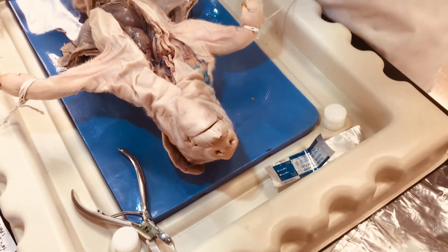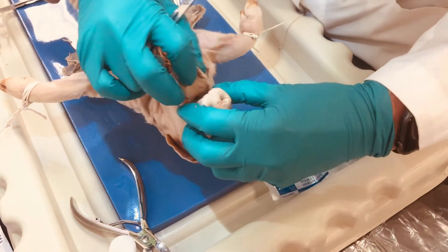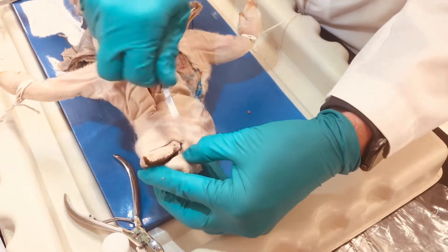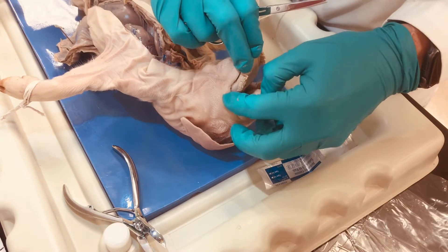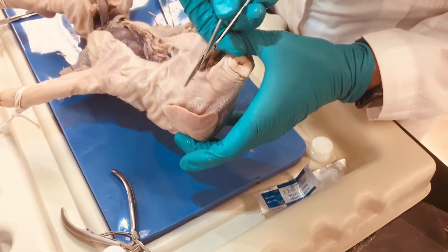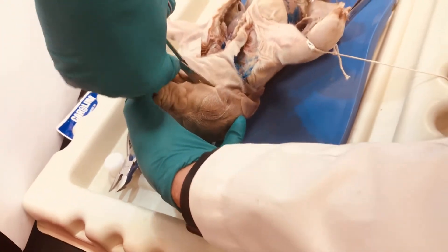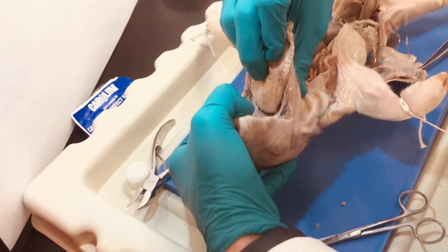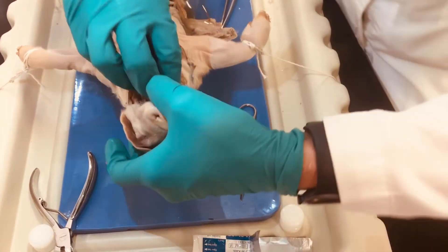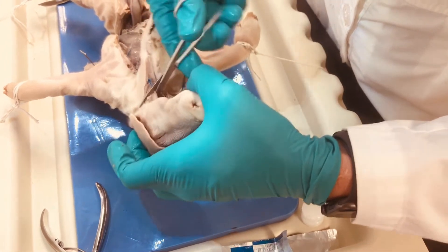All right students — to see the structures in the mouth and to visualize the epiglottis, hard palate, and soft palate, we're going to have to open up some structures in the mouth. You can appreciate we are not going to be able to do this easily without making some incisions. I caution you: when handling the mouth of the pigs, these teeth are very, very sharp and you can actually puncture through your gloves and cause injury. So be very careful when handling the jaw. We are going to make two incisions on the lateral aspects of the jaw, cutting through the buccal tissue and actually disarticulating the jaw. This will give us visualization of the epiglottis and allow us to see those structures. Understanding the opening to the trachea and the esophagus is very important if you're going into the medical field or want to know about anatomy.